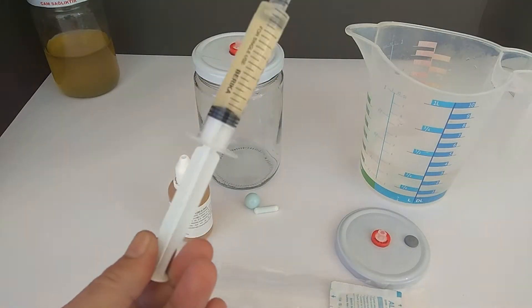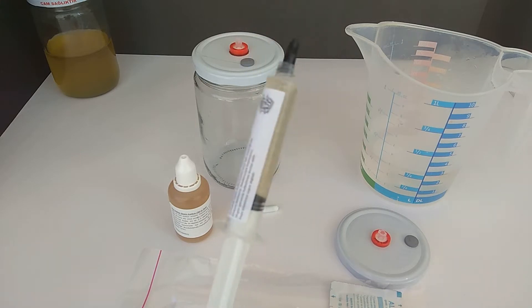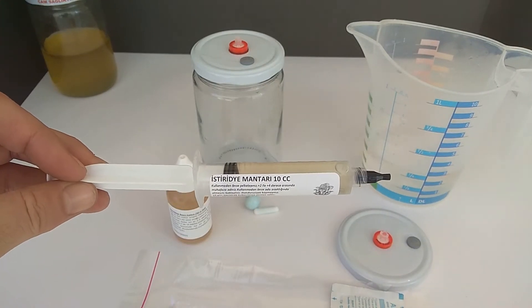With this method, we'll have enough liquid cultures to experiment a lot and we will save money. Let's get started.